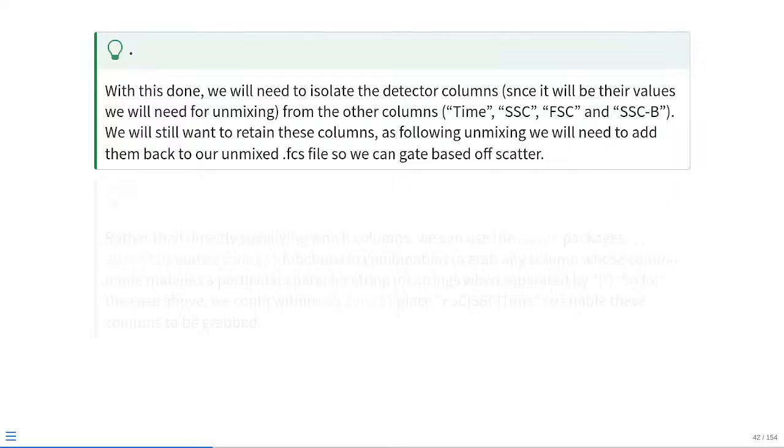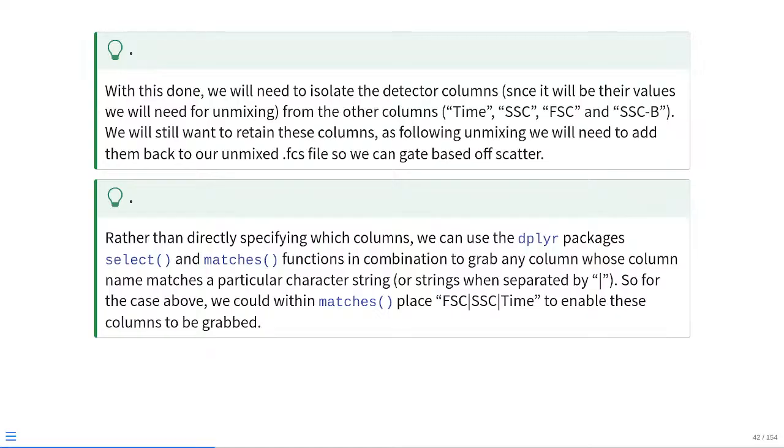our monocytes, or our granulocytes. Rather than simply specifying each individual column that we want to retain, we can use the combination of the dplyr package's select and matches functions to basically grab any column that has a column name that matches particular character strings, or multiple strings if we're separating them by the little pipe. So in the case above, we could basically place inside matches a character string like forward scatter pipe, side scatter pipe, time. And in that case, as it checks the column names, anything that matches or partially matches those character strings will end up being selected and saved out as its own little data frame.